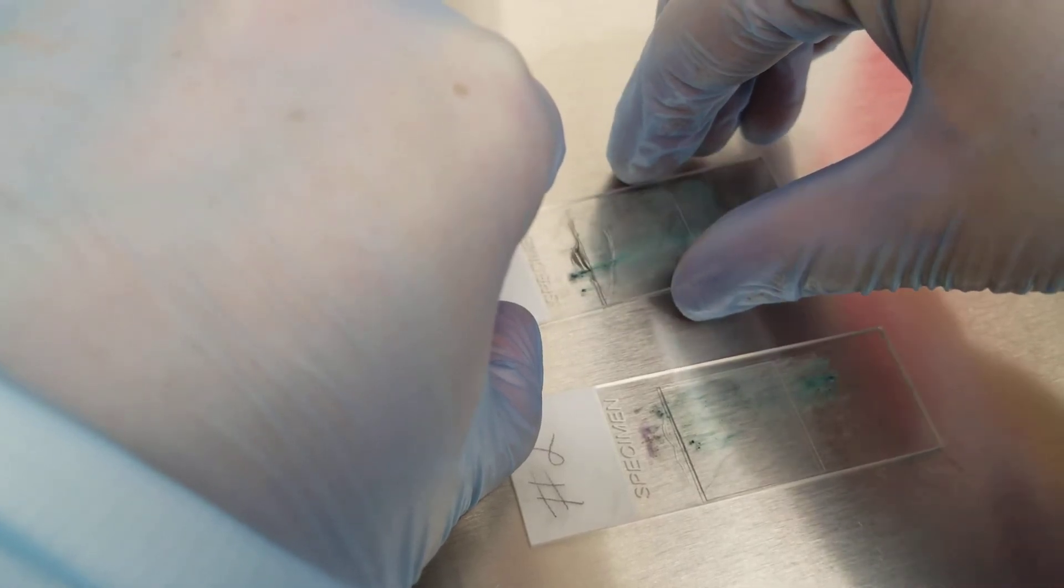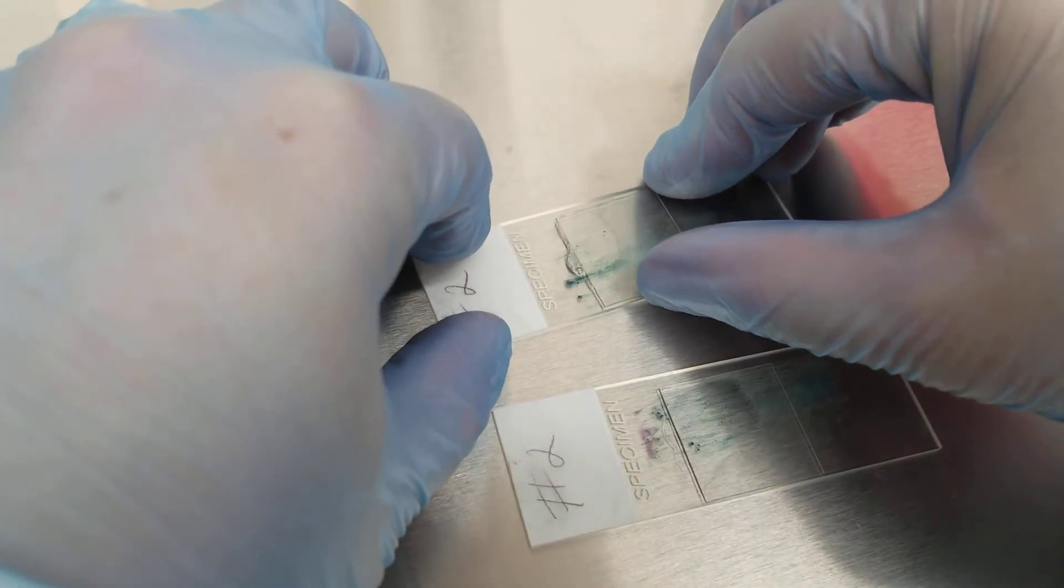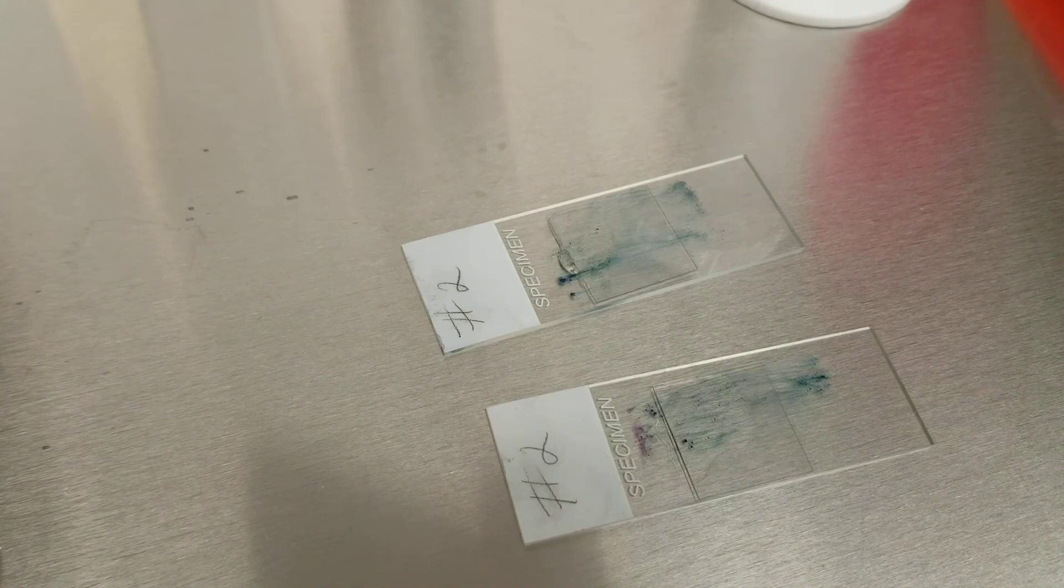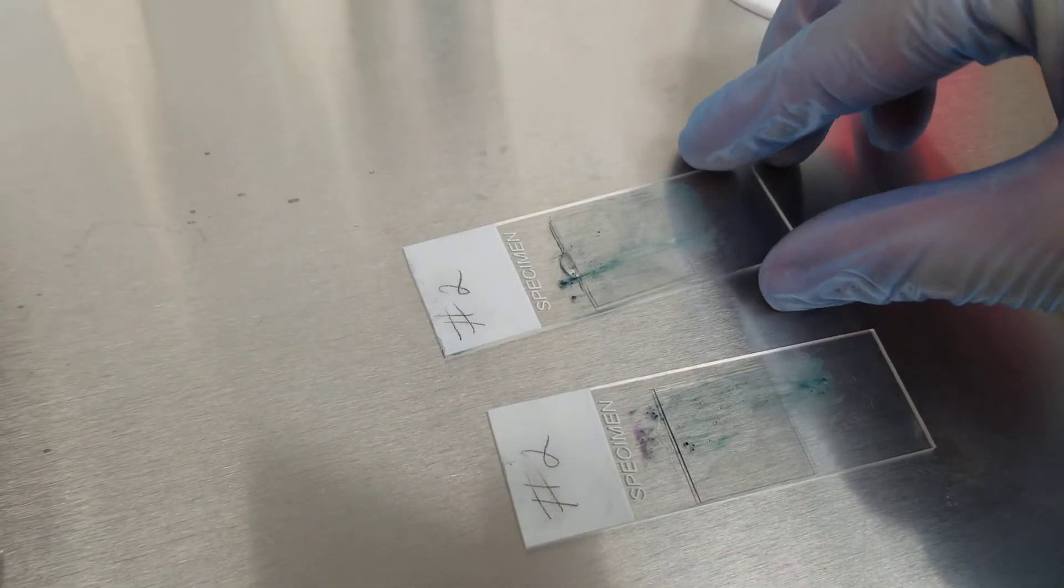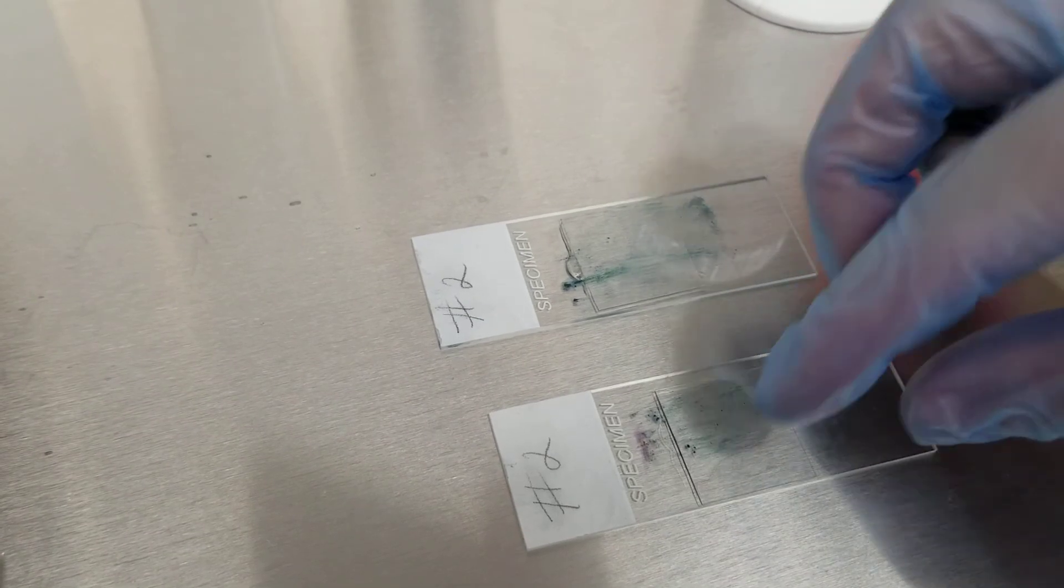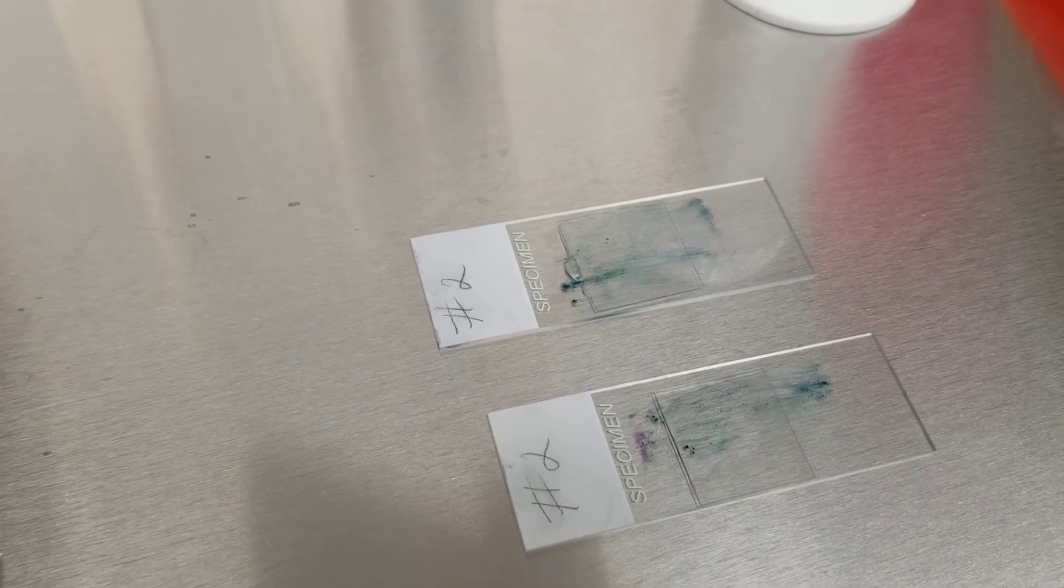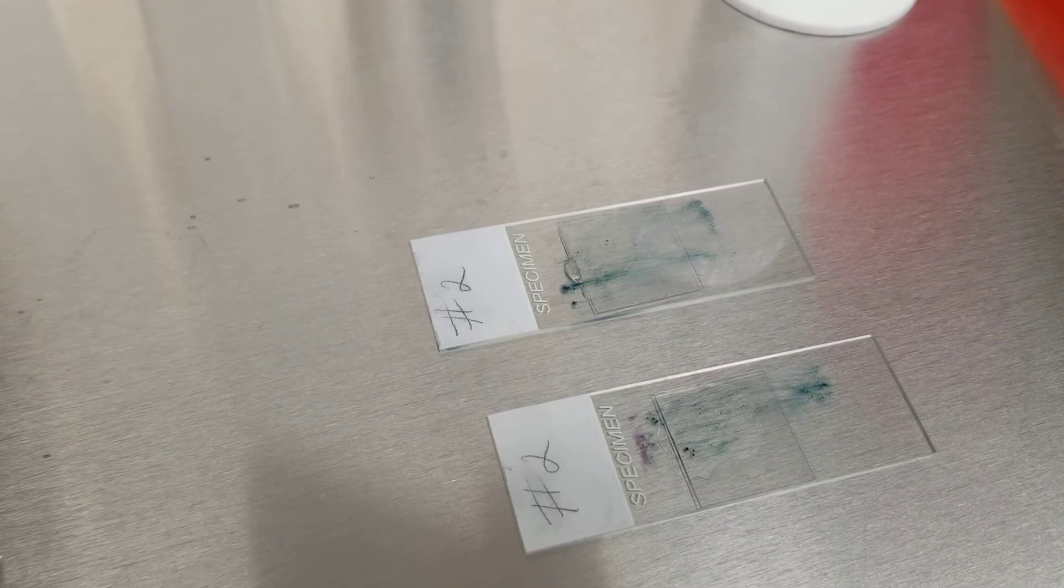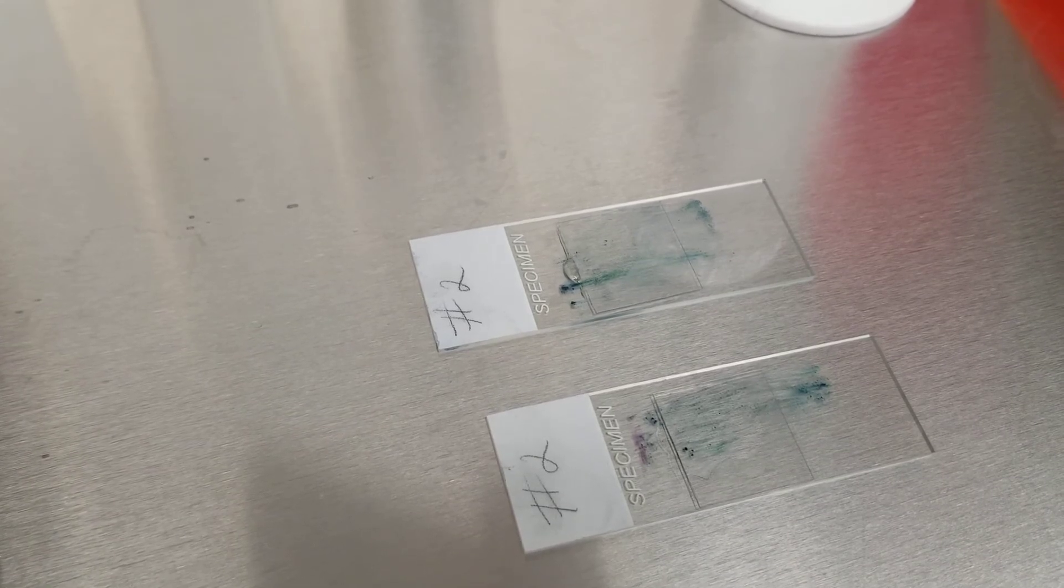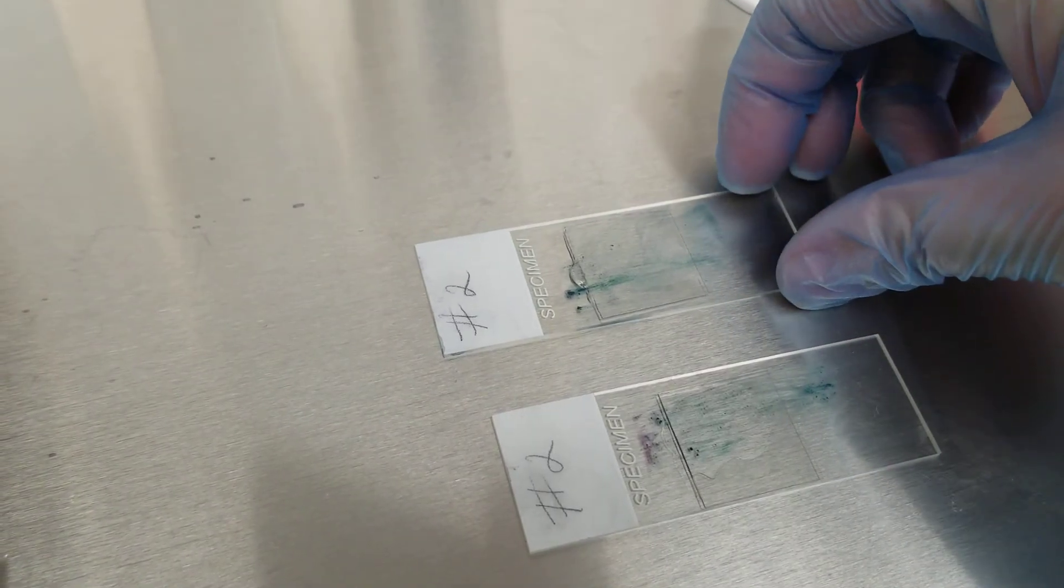So let's try this one. Alright, it's slowly spreading throughout and it may take some time. But what's going to happen afterward is after this has done spreading down the slide and the coverslip intersection, we're going to put them on the slide warmer again and we can put it on there for an hour to heat it up, to make it dry and provide a permanent record of these beautiful slides.